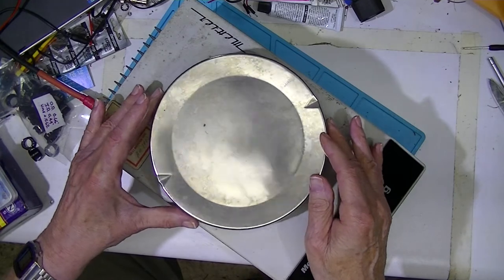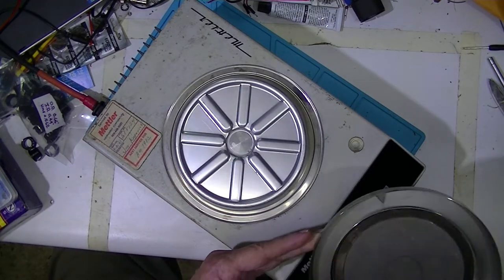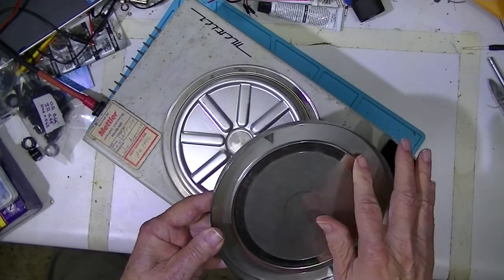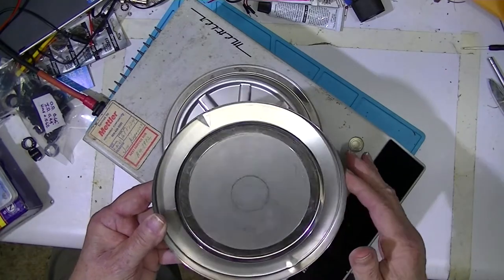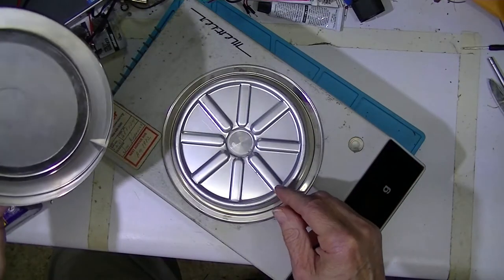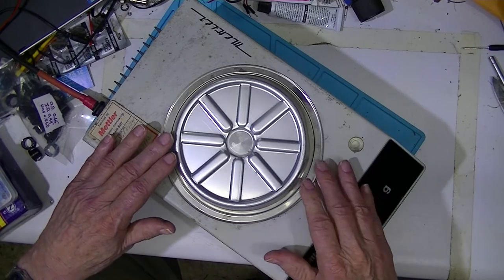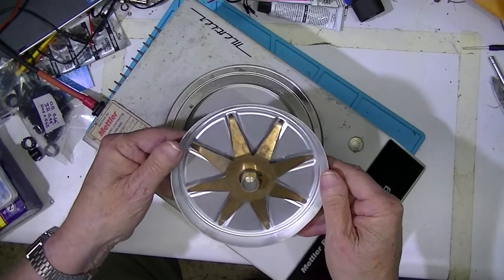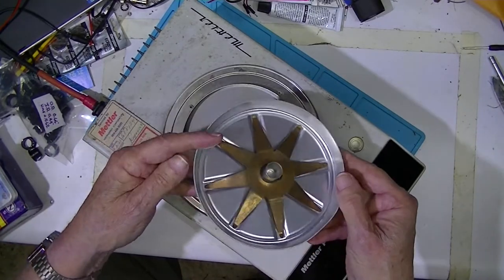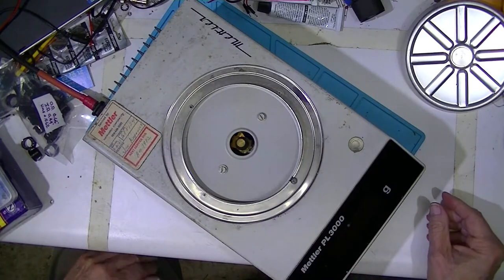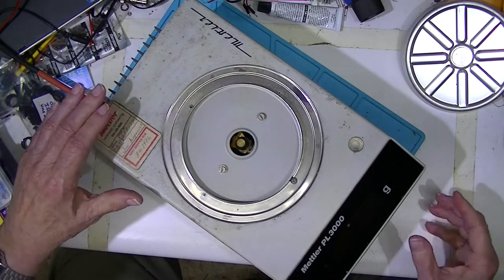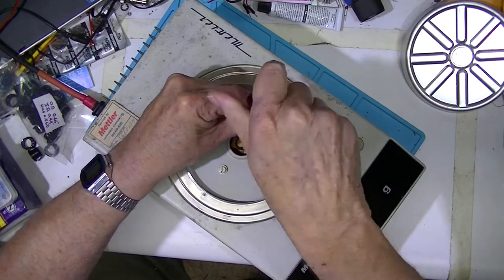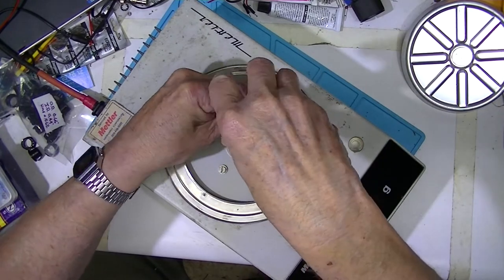There's a stainless steel plate on top of it, it's just really an inverted pie plate. It has an inner drip ring, and of course the outer serves as a drip ring. This inverted pie plate is held by this plate, which is somewhat heavier aluminum plate. I'm hoping that these two screws allow me to take this cover off. I've never had this open before.